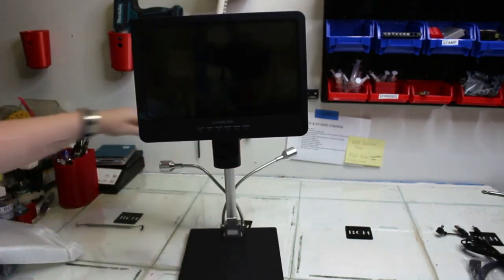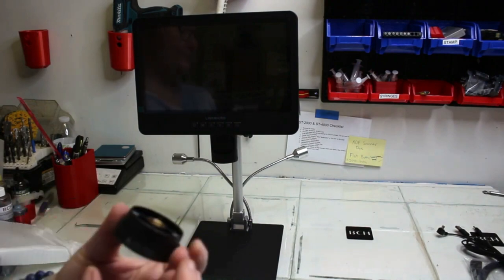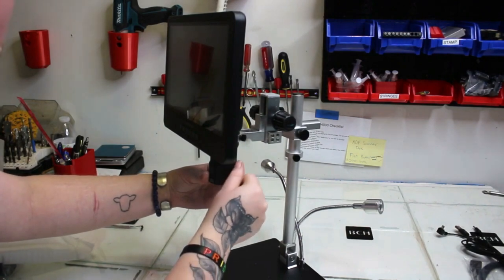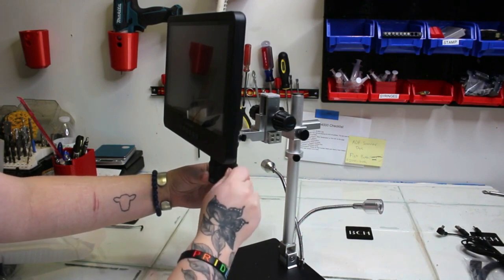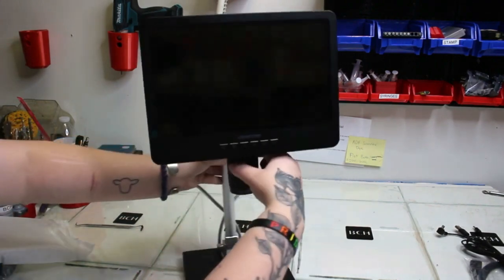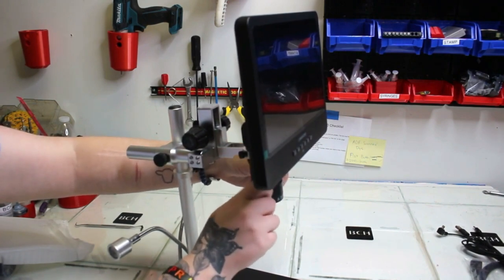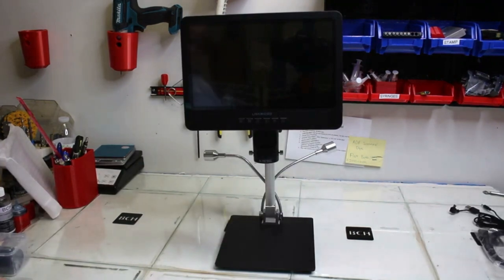The microscope doesn't have the lens on right now since we took lens A off, but we're going to put lens A back on. Lens A is good for looking at typical items like coins and rocks — just general observations. On the lens there are two golden circles on either side where the screws go in. Line them up and put your screws in — again, you don't need to make it extremely tight, just enough to hold it in place.